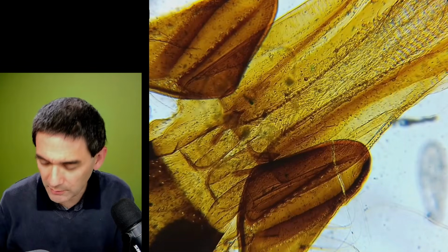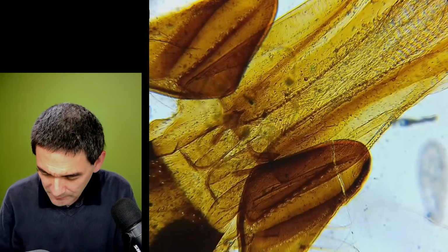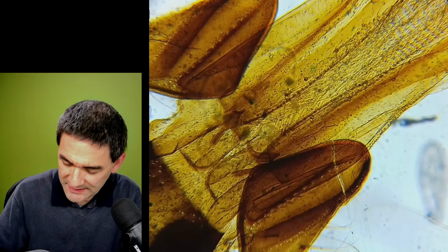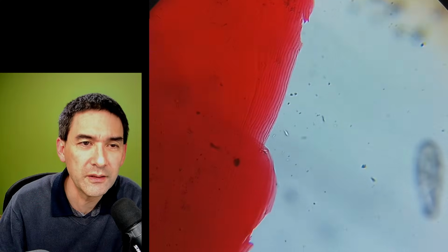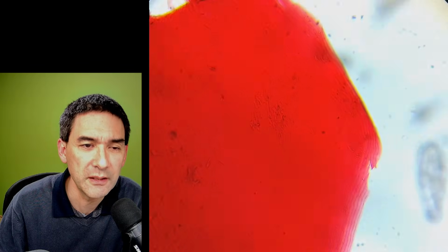So let's, I think I'm just gonna pull out a couple of random slides here. I don't know, what's fish scales. Yeah, so these are fish scales. Oh, they're not very interesting. It is just red. Here on the side, maybe something slight. No, those fish scales. I mean, what do you expect? I mean, they're made of what? Protein. Probably not even very many cells. Maybe not even cellular in nature. I think that's pretty boring, this one. I think I'm gonna go for another one.